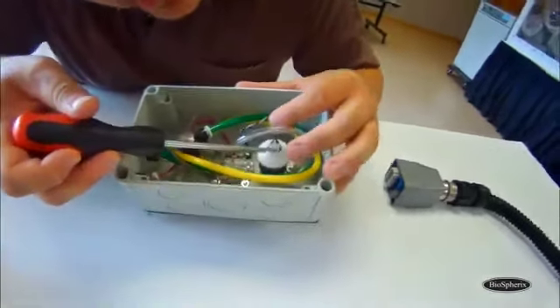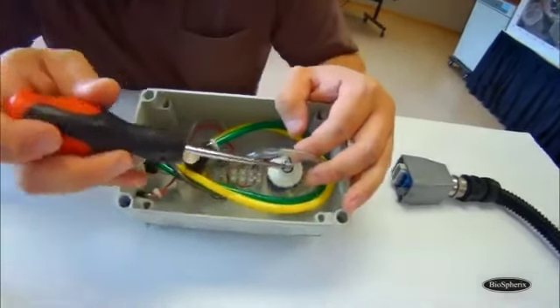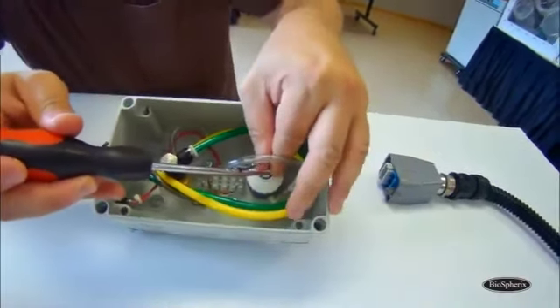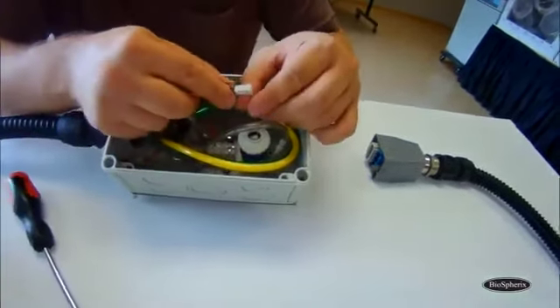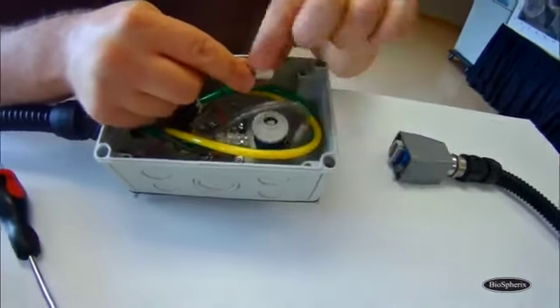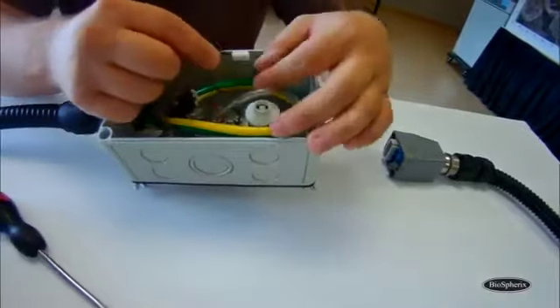There's a small little lip holder. You just slide your screwdriver right down there, push it forward, and then be careful when you do it, but you just take the plug out. So I'll show you, there's this little tooth. That's what that lip catches onto, so we're just sliding that lip forward gently and pulling the clip out.